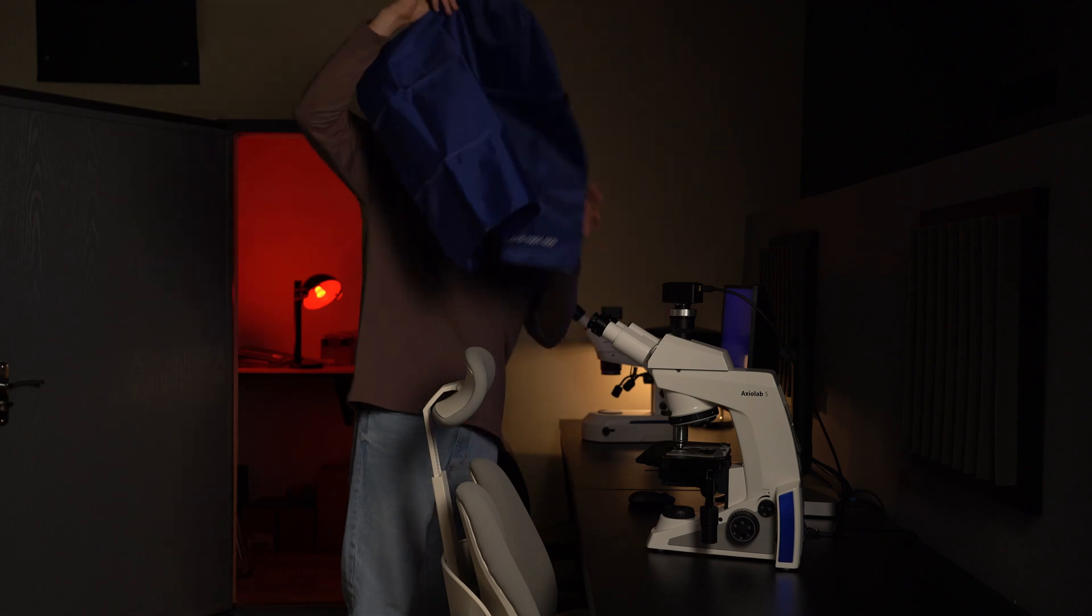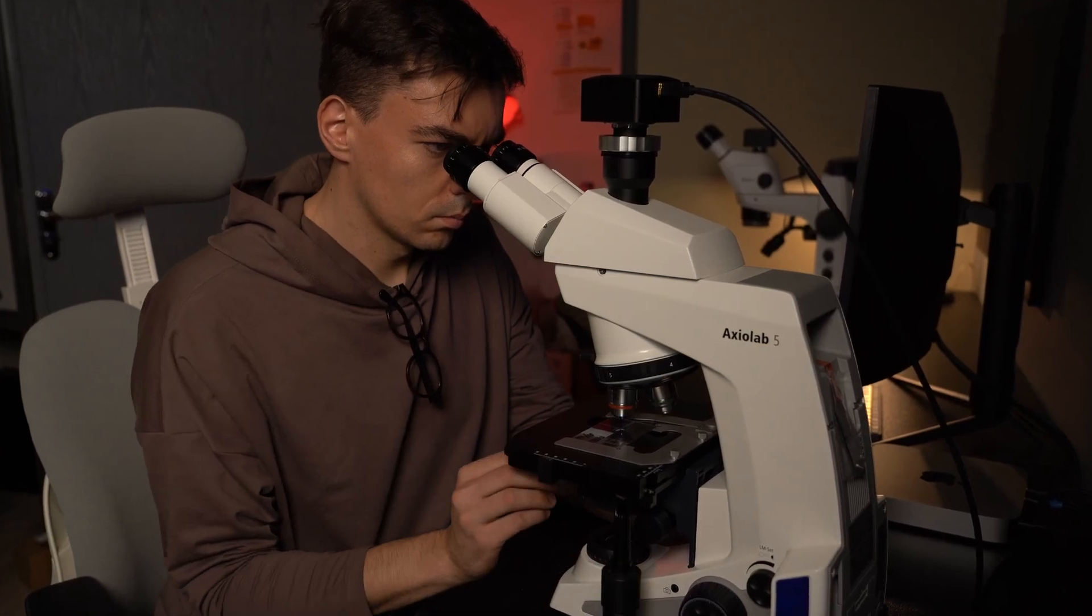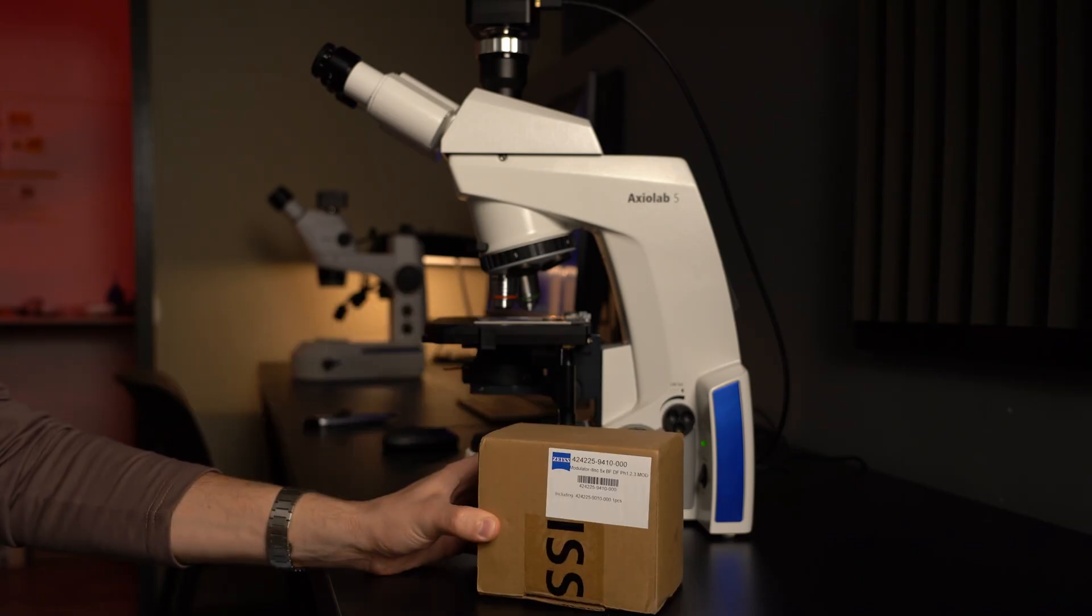It's simple and inexpensive to adapt your upright or inverted microscope for phase contrast. Only two components need to be installed.